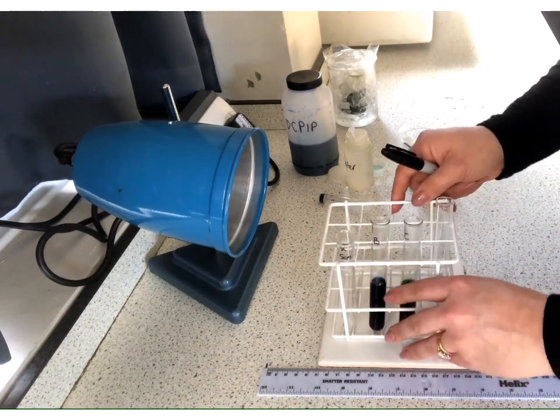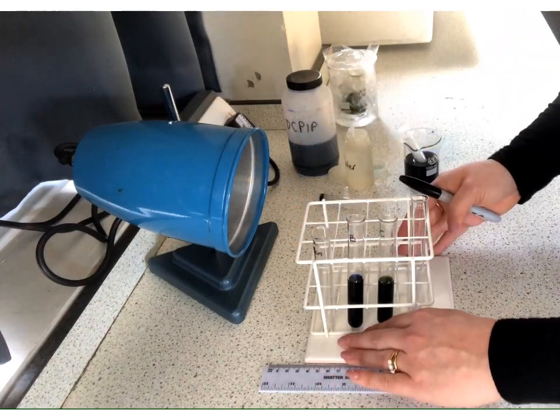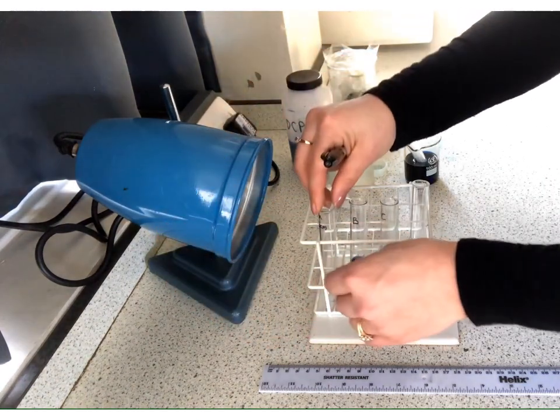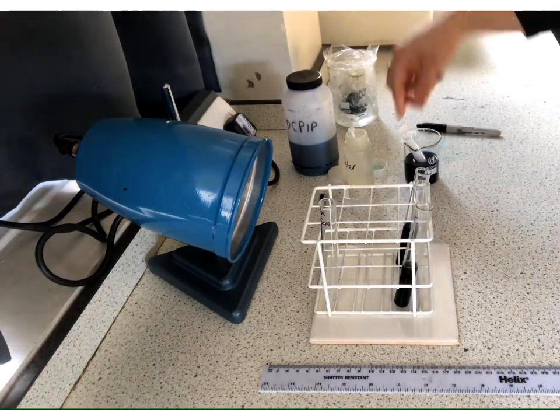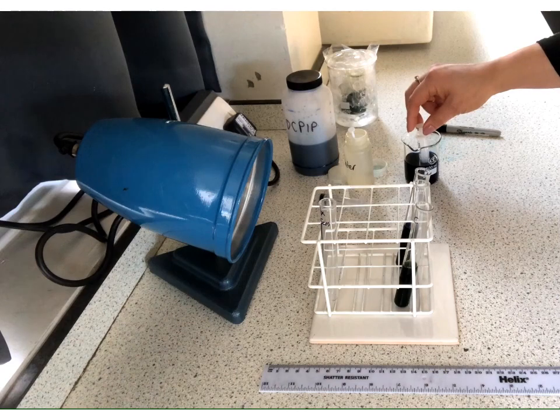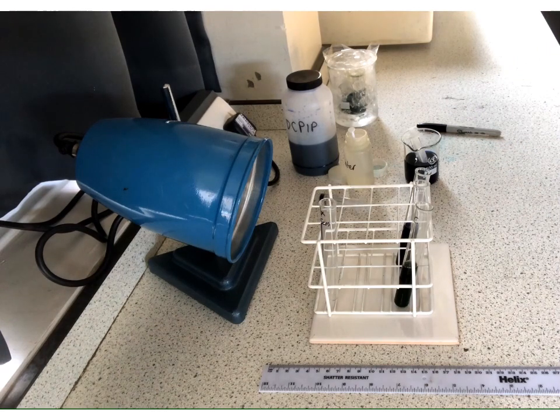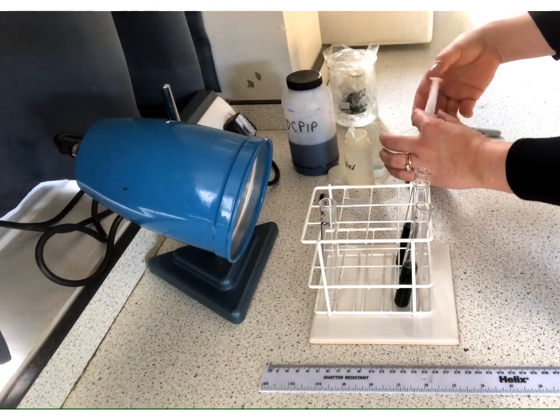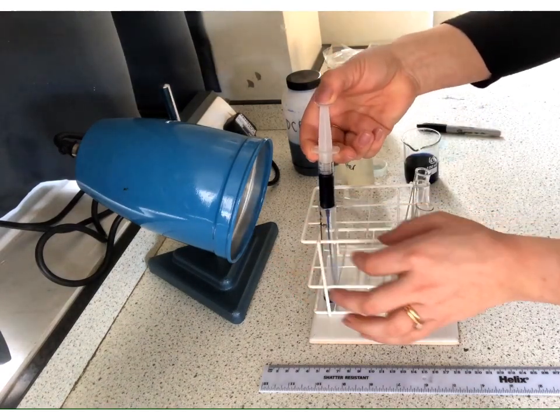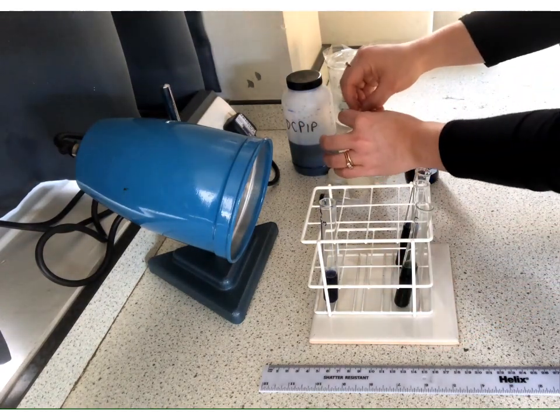So we're going to place this tube here, and as I say, I'm going to get it in position. So I want it 5 away. So if I line up the tube correctly with the 5 mark, make sure that this light is shining on it fully. I'll move these ones to the back. Okay, and then we will start adding them in. Now, things to be aware of, obviously, it's a practical, we're in a lab, we shouldn't be eating, we shouldn't be drinking, but also DCPIP can be an irritant to skin in the right concentrations, but also key thing is eyes, so we should be wearing eye protection throughout. So we're going to have our 5 of the DCPIP. Obviously, if you get any spills or splashes on your skin, you should rinse them off straight away. 1 of the water.